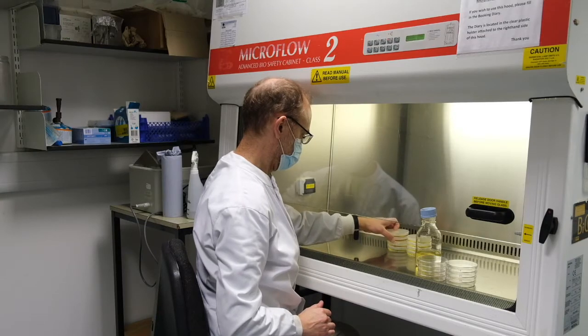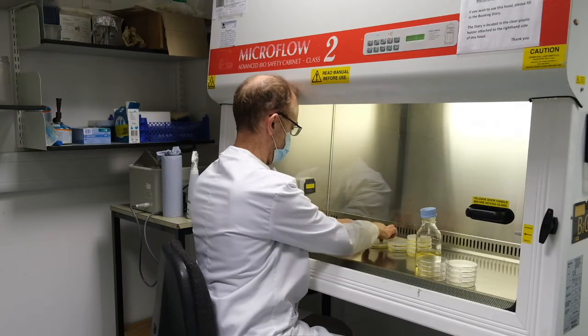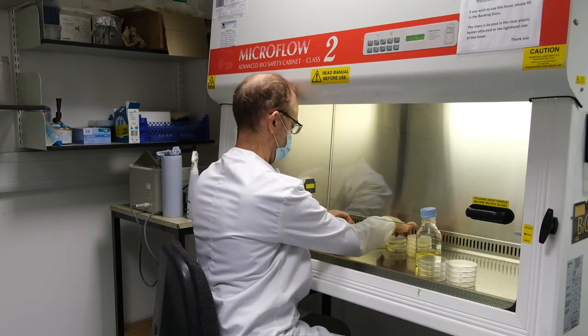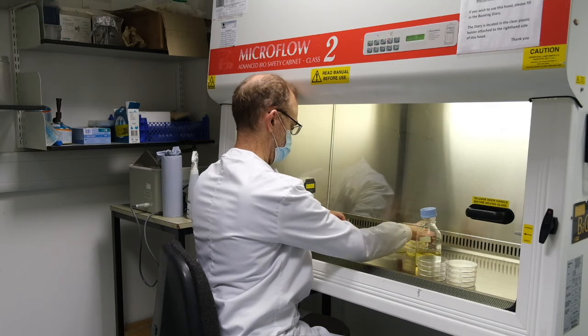After pouring each batch of plates, leave the lids ajar to allow excess moisture to dry from the plates. To save space, arrange your plates in a pyramid while they dry.